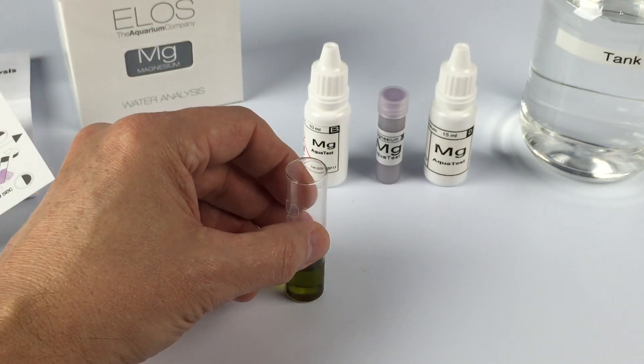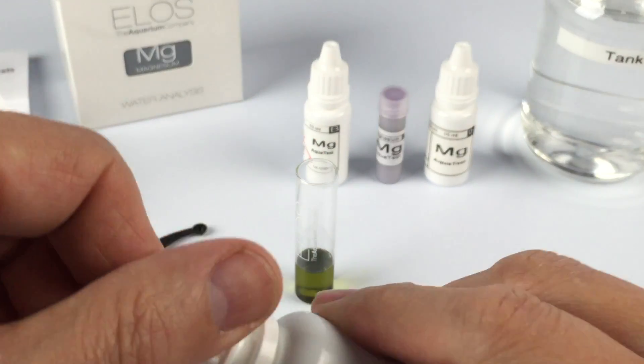I have to remember 29, rinse out the vial, and get ready for the next part of this test.